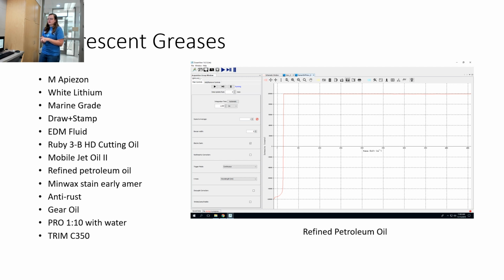instead of being like a square, it would be like an oval, a kind of rounded top. But it would still be saturated, because this is saturating the detector completely. At least you're collecting the signal. I think the lowest integration time I was able to use on this Ocean Optics detector was 15 milliseconds, so 0.015 is about as low as I've gone.